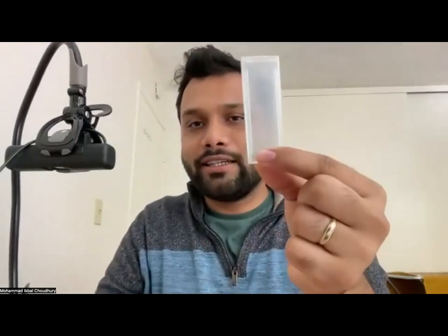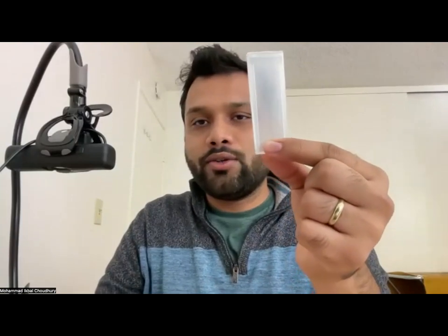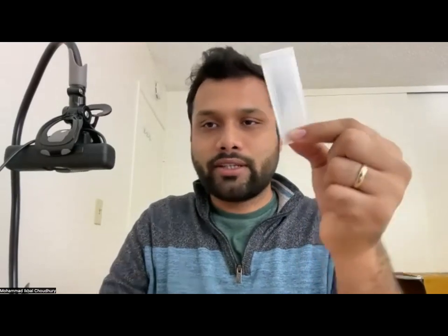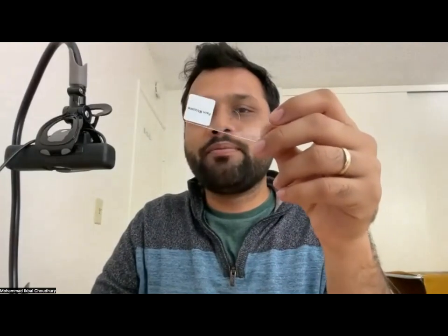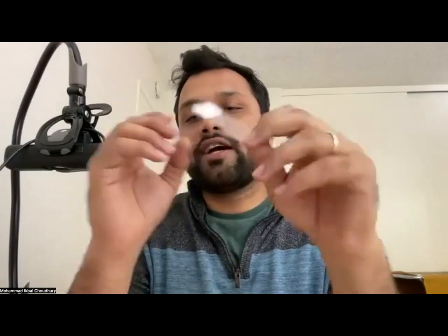Now, in your foldscope package, you must have received a plastic box like that, which has glass slides in it, right? So let's take a minute to find that box. Perfect. I can see Jim and Chip display the box. And so let's take a slide out that says fern rhizome. All of you may not have received the same slide, but you may have received some kind of pre-made slide. Okay, so mine says fern rhizome.